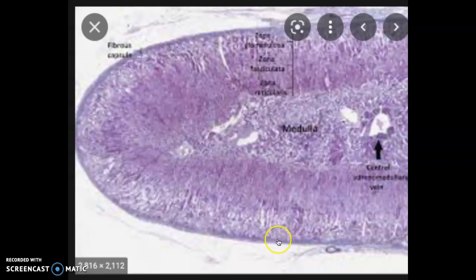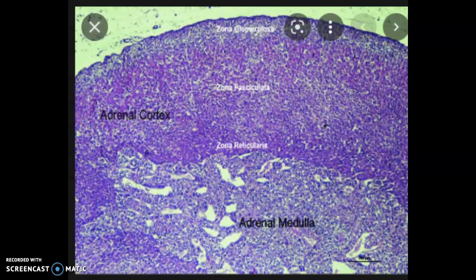I know that this darker color is the glomerulosa. The fasciculata is always white. So this one actually has a humongous reticularis. Our slides don't. And then we have the medulla.